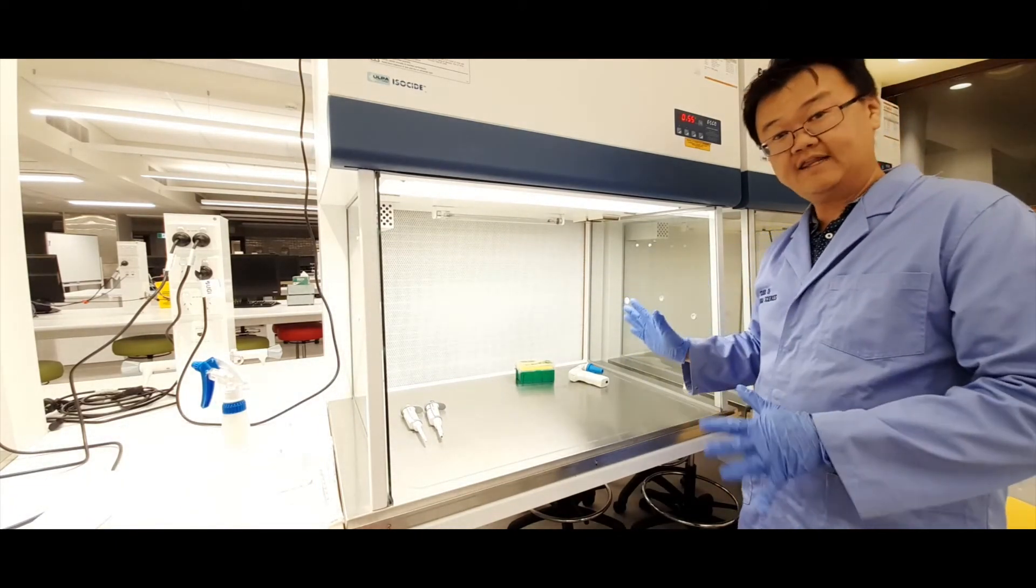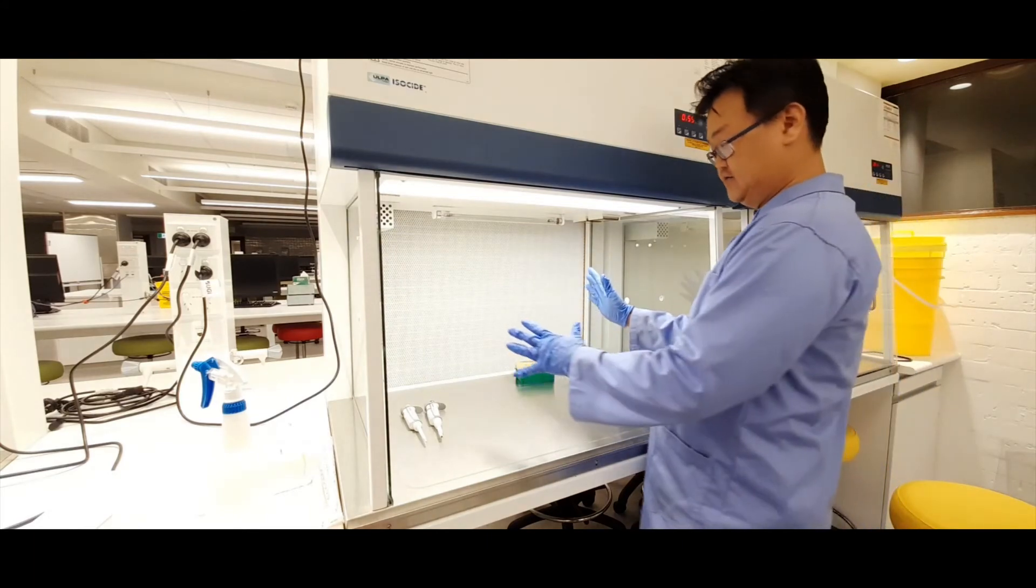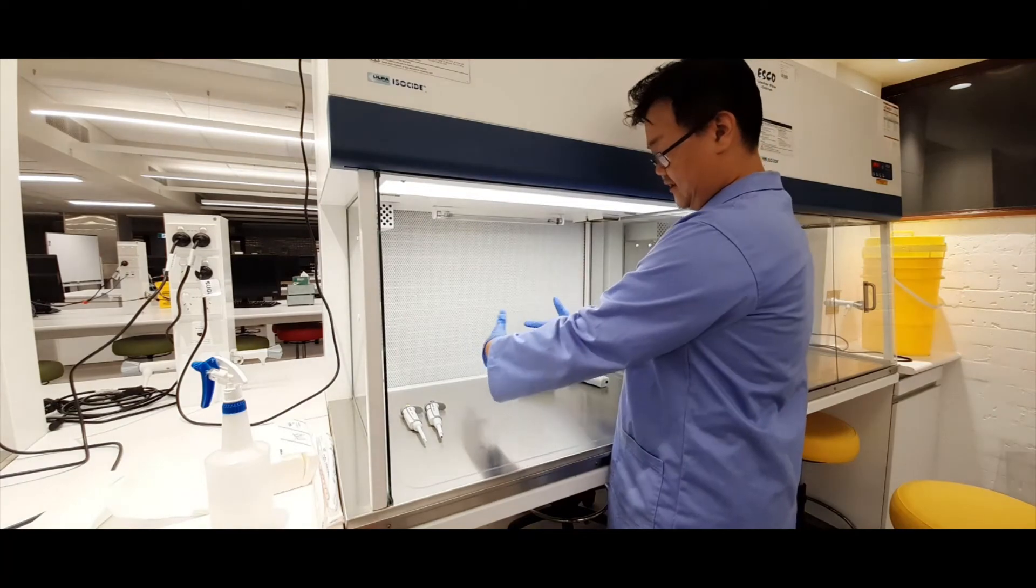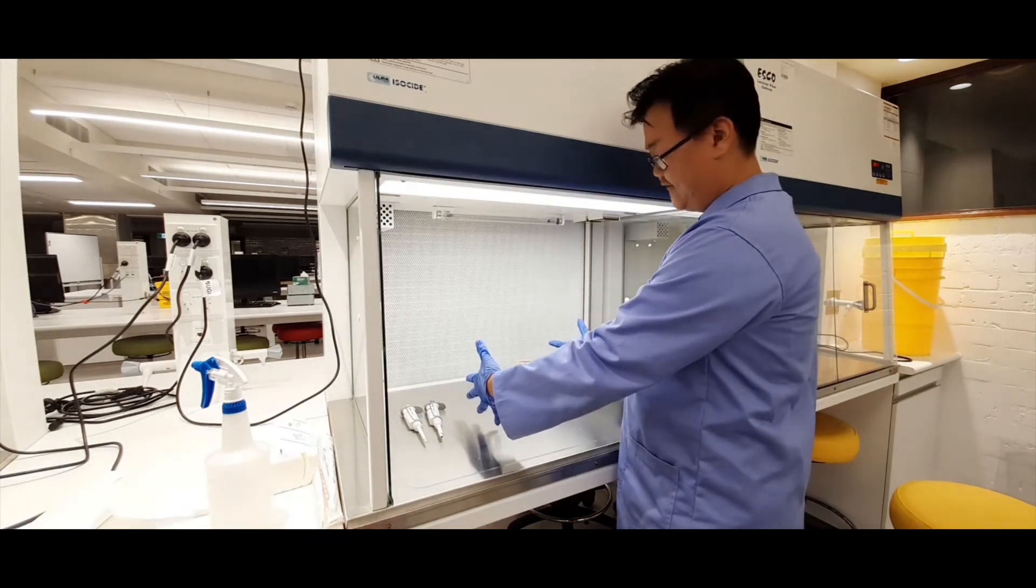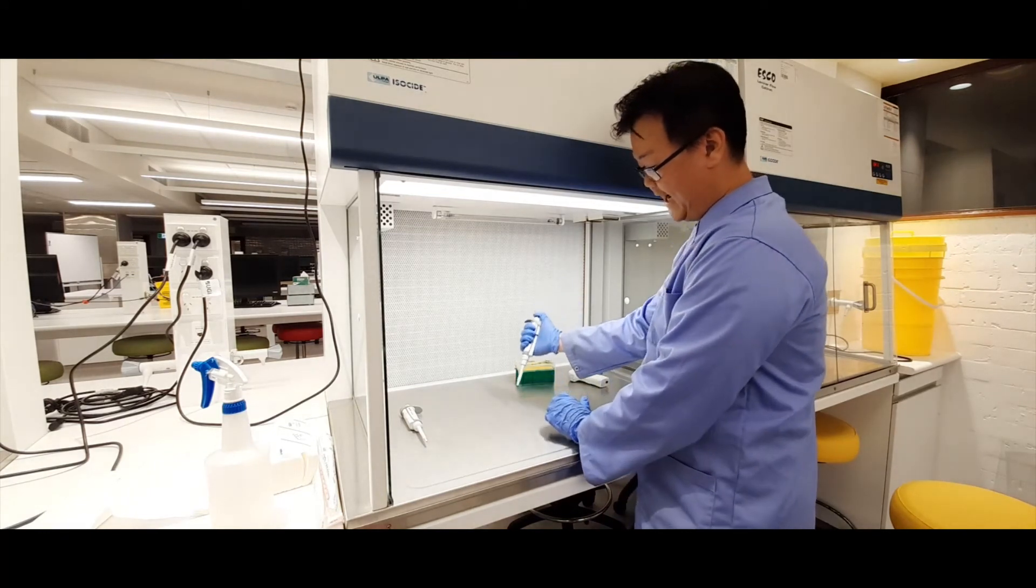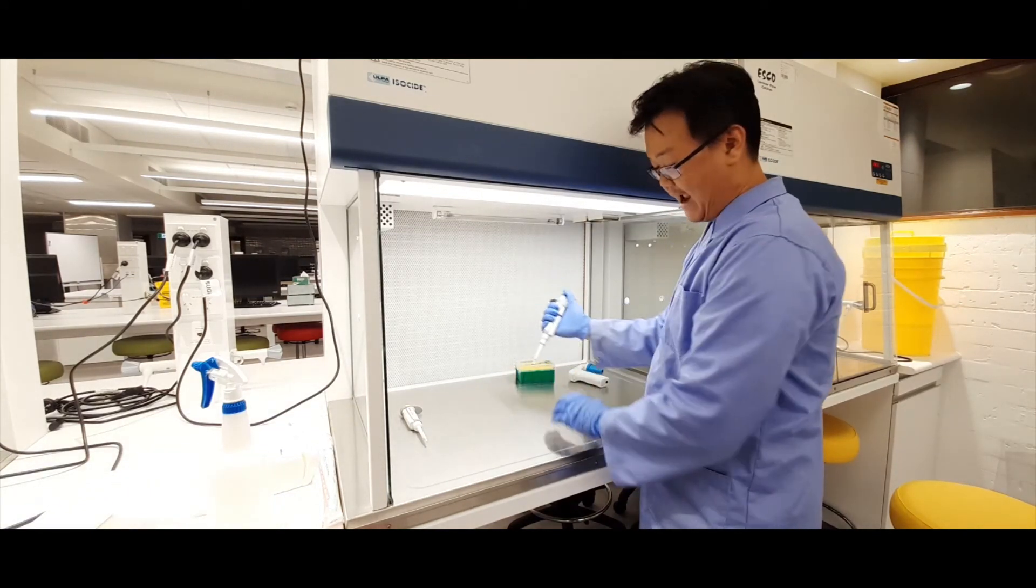The way you work in this hood—as I said, this is the sterile working environment—so you want to work with your hands inside this work surface near the center. So if you were pipetting something, you want to do it here inside the hood rather than at the edge here, where there's greater potential for contamination.